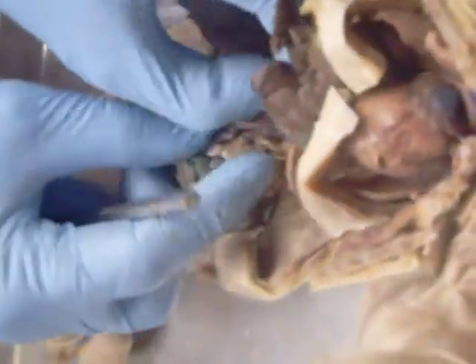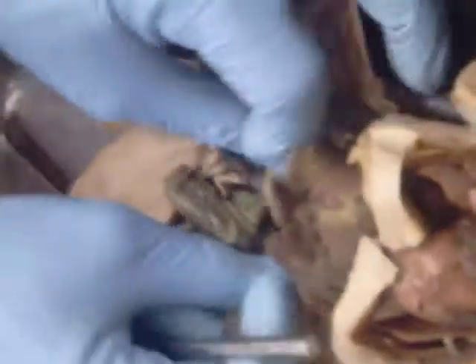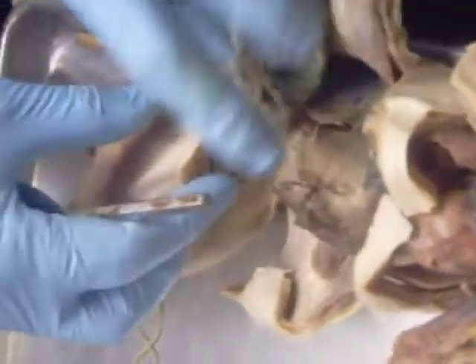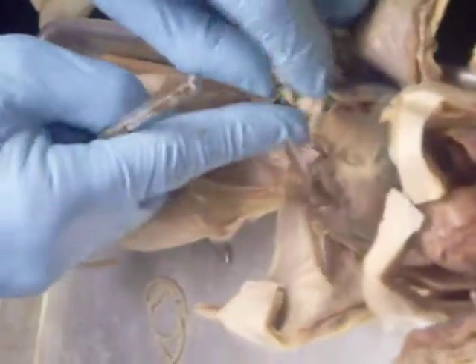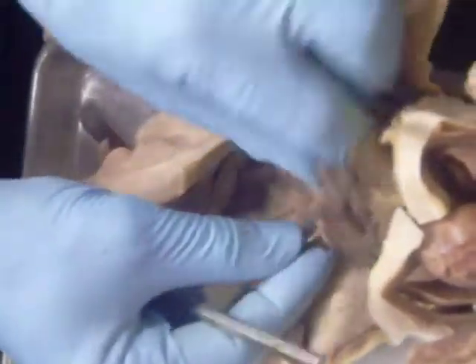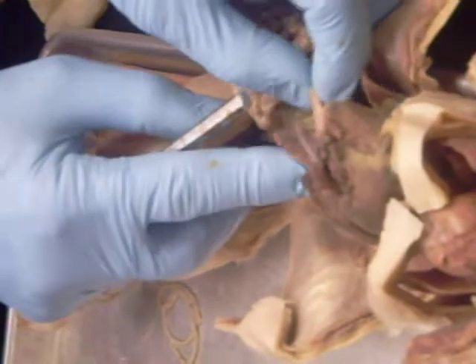That takes us to the stomach, which is here. The body of the stomach, pylorus of the stomach. That turns down here into the duodenum of the small intestine. And this thing that looks like a bunch of beads in between, that's the pancreas. The thin material is small intestine, the thicker is colon. This is the descending colon here. This thing is the spleen.